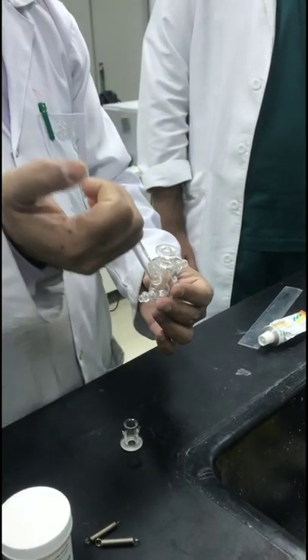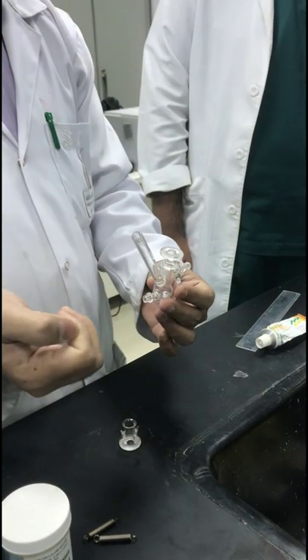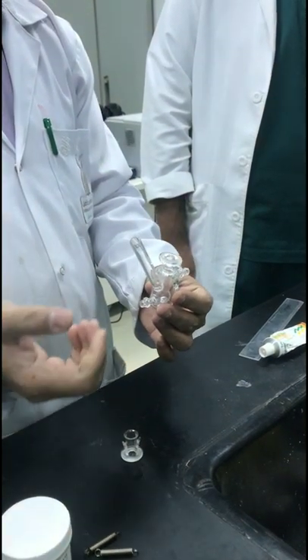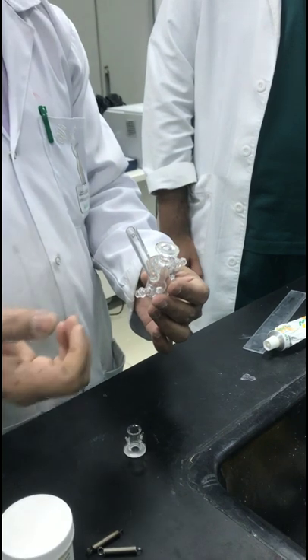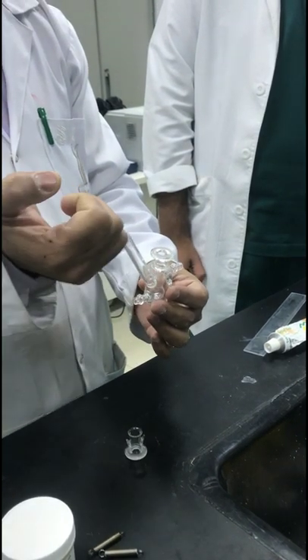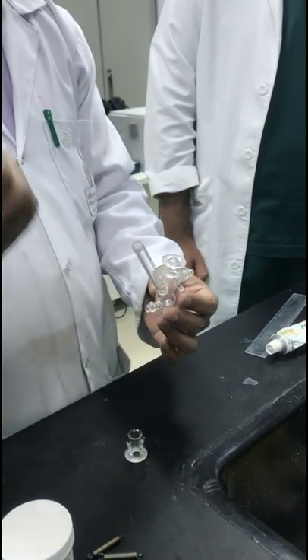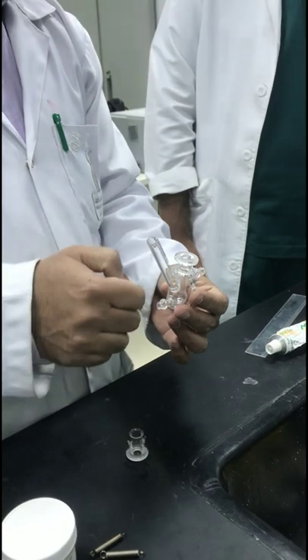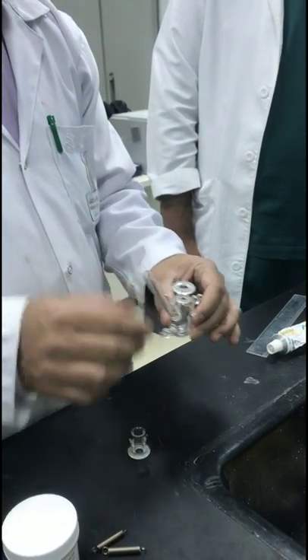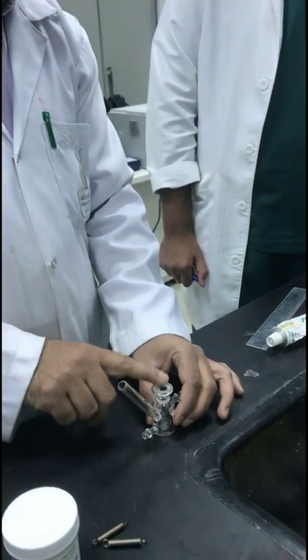This port is for introduction of the diffusion media and also for sampling. After putting the media in, you can take samples from here at half-hour intervals, or faster — every 10 or 15 minutes. You take the media from here and also replace it with fresh media.